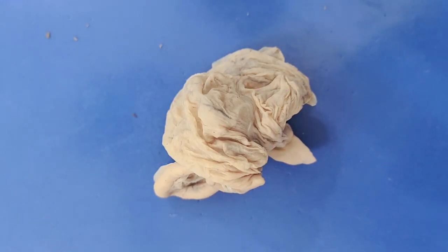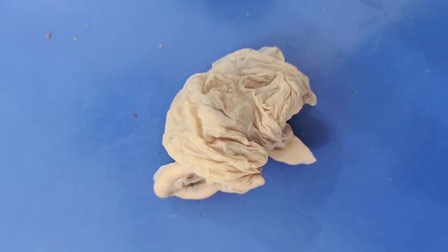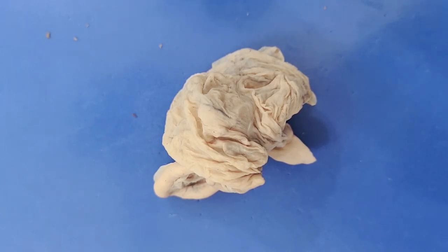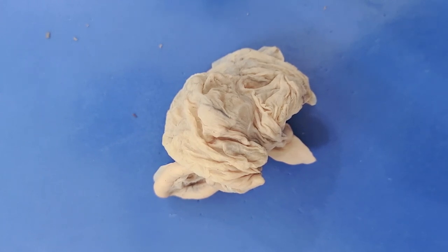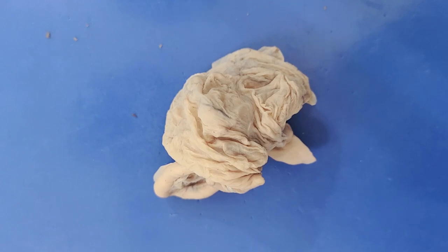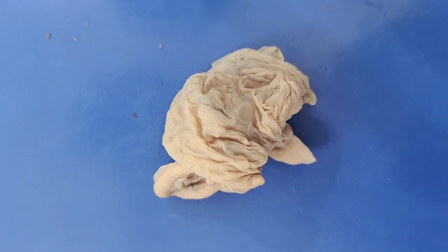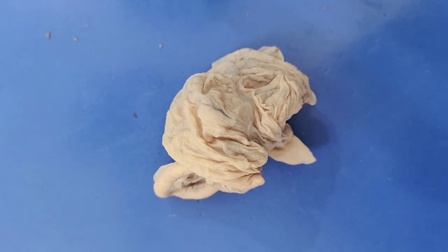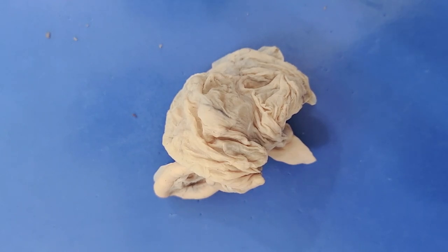Hello and welcome. Today we'll be looking at the anatomy of the ovary. This is a pig ovary, which is very useful in showing us the anatomy and physiology of the mammalian ovary, even if it's not perfectly similar to the human ovary. The ovary is responsible for several functions, chief of which is to produce eggs for reproduction.